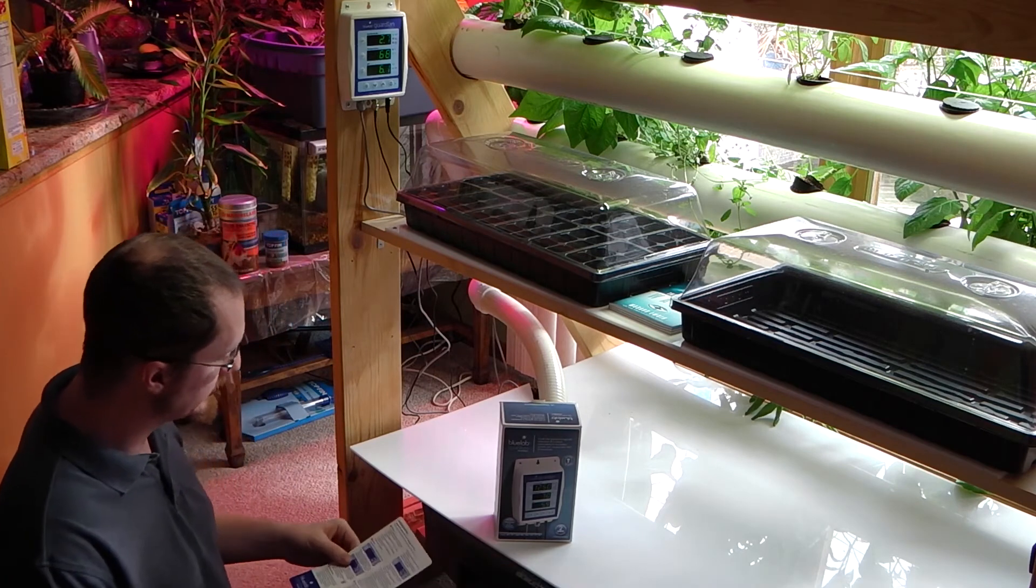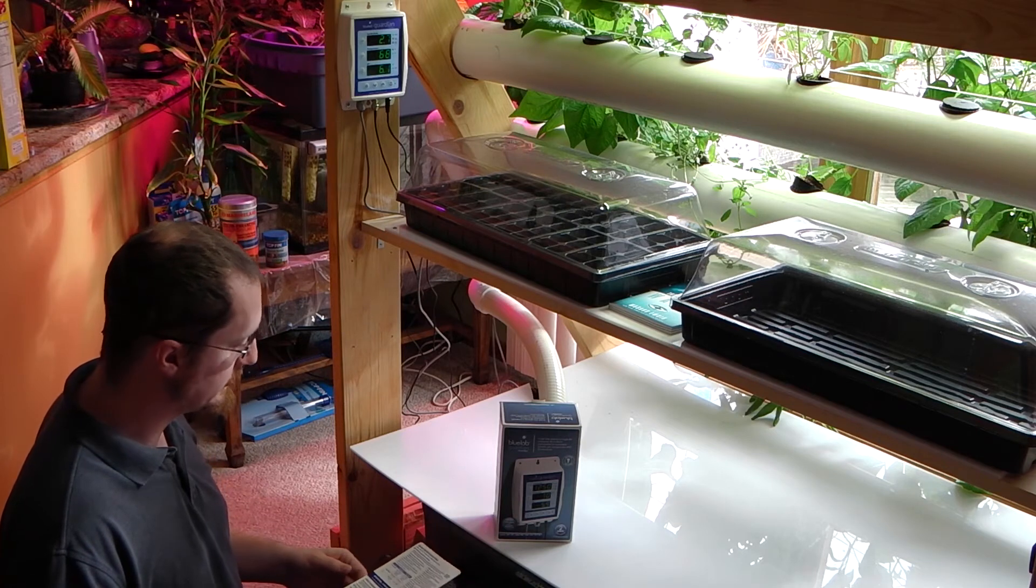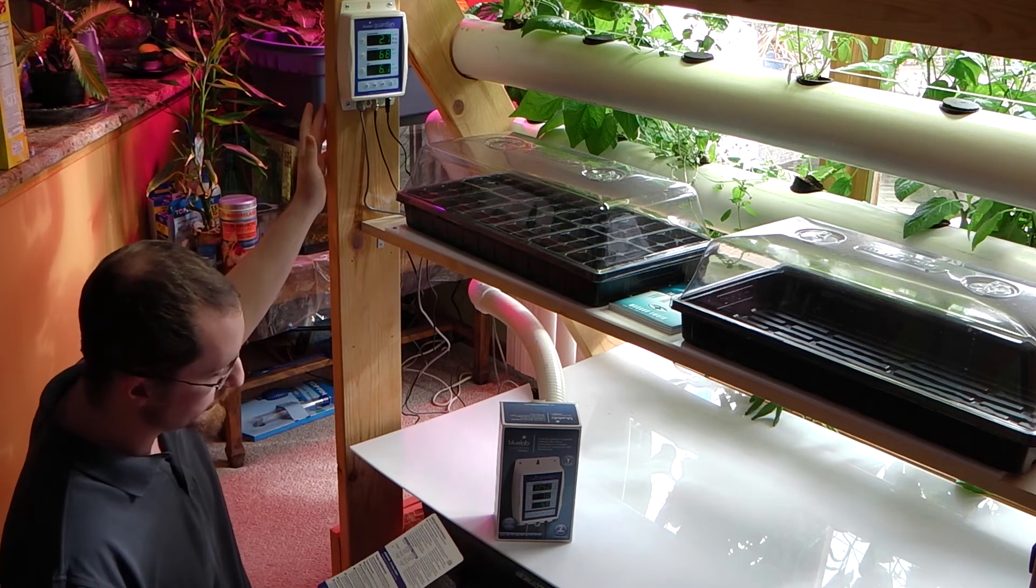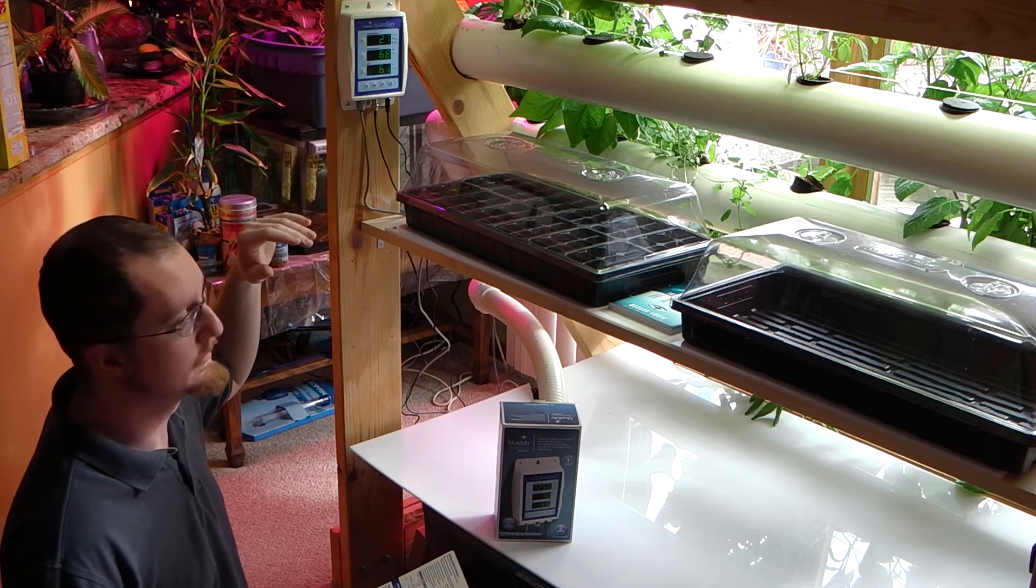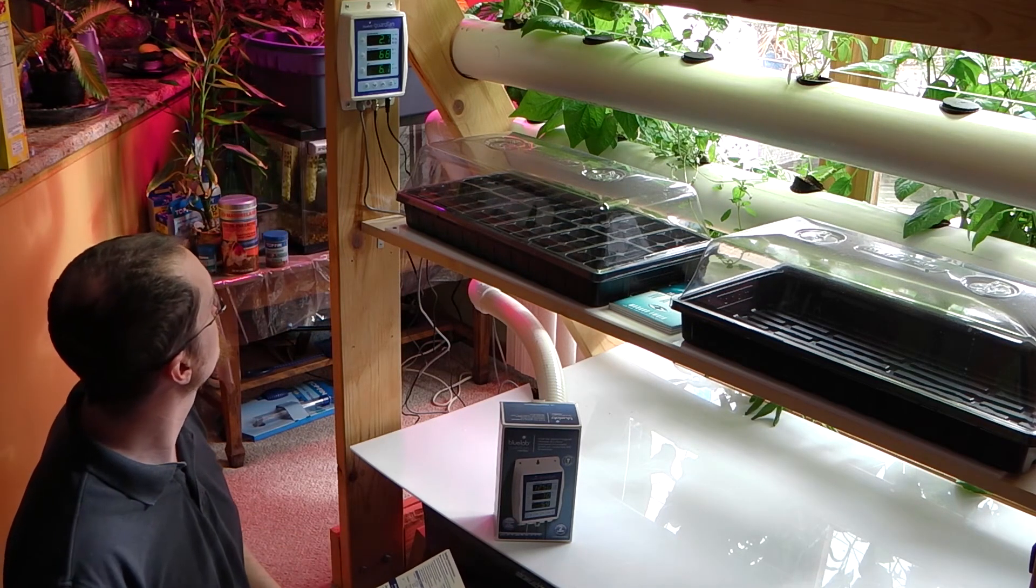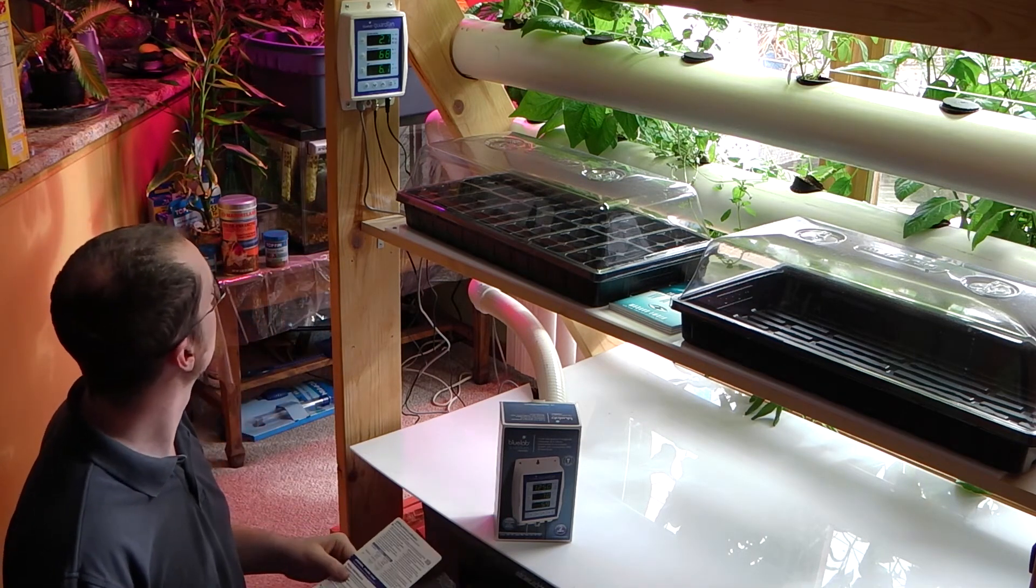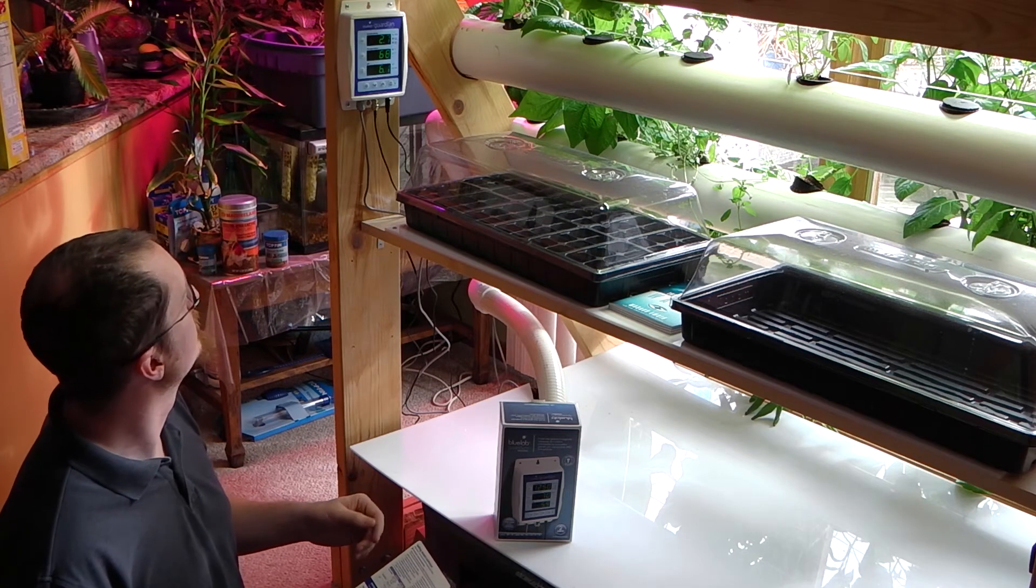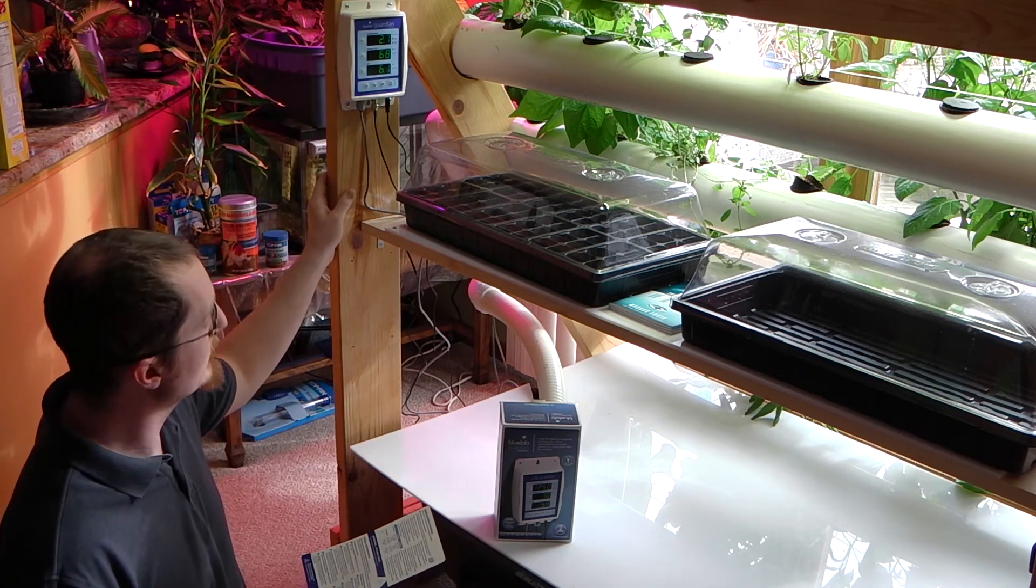Right now, the only thing I really have left to do, since the unit is already in my reservoir tank, is you can set an alarm, and it'll flash if it exceeds or goes below certain set values. You can set it to your own custom values, or you can do a quick set, and I believe it'll go up or down 2 tenths or so. I'm going to go ahead and set that alarm.